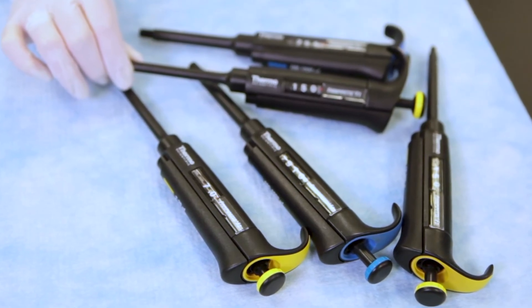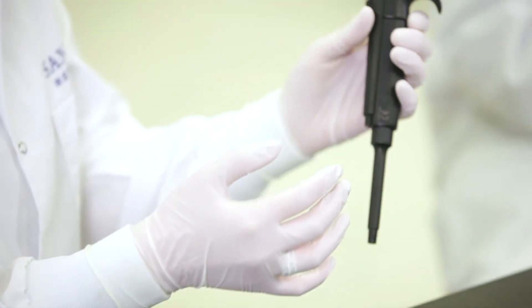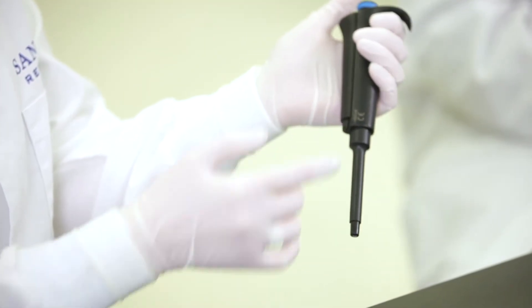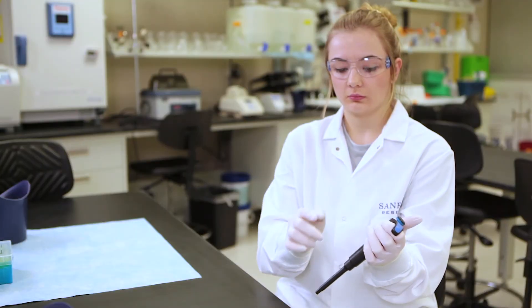By mastering a few simple techniques, you will have an important new lab tool, and your accuracy will increase. But before you can get started, there are a couple of important first steps to take.